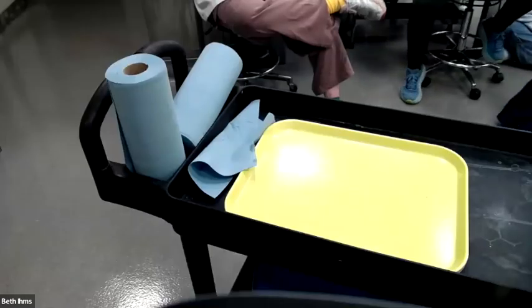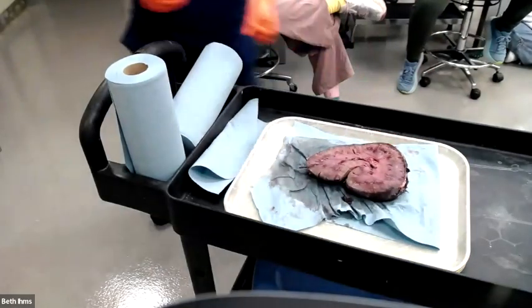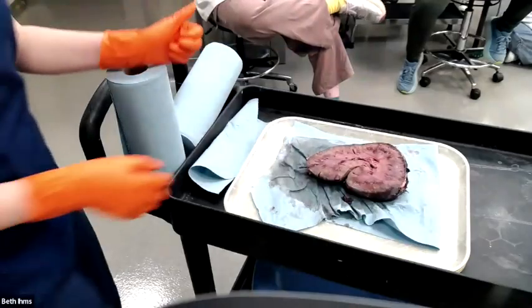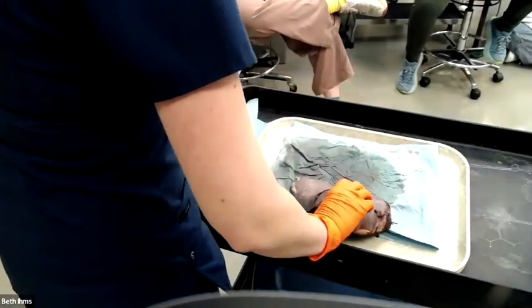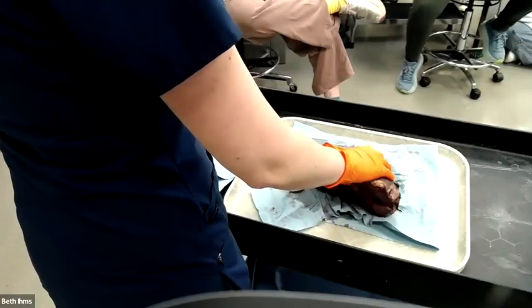Kidney. Oh, I love this one. This has pus, so it's the best thing today. All right, so this was tissue from a horse. Make sure you pay attention to those history and signalment papers I give you. There's a lot of information in there.